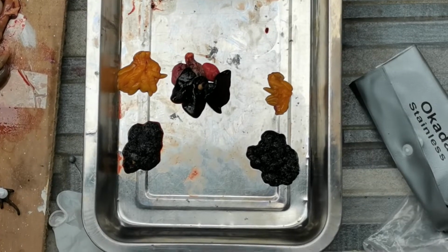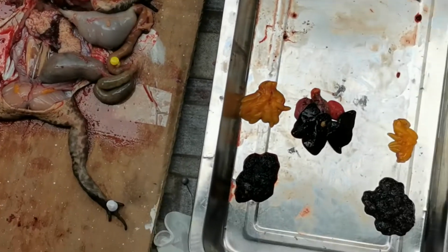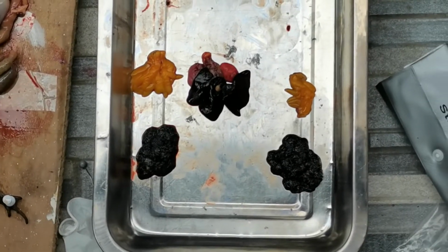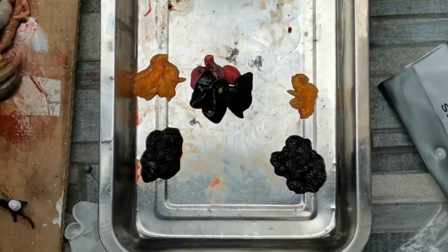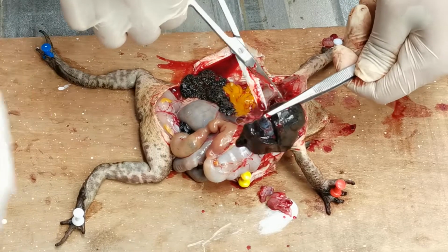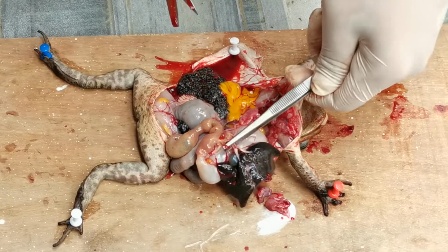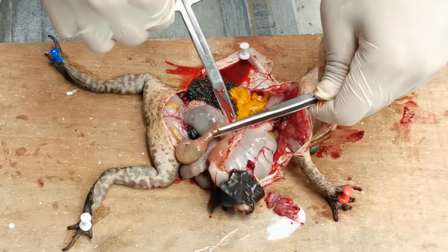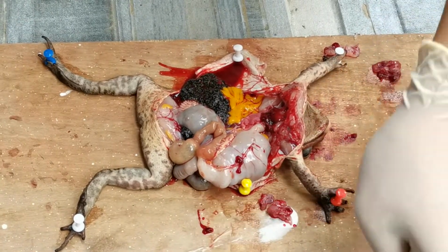In the mesentery, between the stomach and duodenum, lies the pancreas, a glandular organ that produces digestive enzymes. The pancreas empties its enzymes through a duct that leads into the small intestine. The dark spherical spleen, which is a circulatory and lymphatic system organ, lies in the mesentery posterior to the stomach. One of the spleen's functions is to store blood.